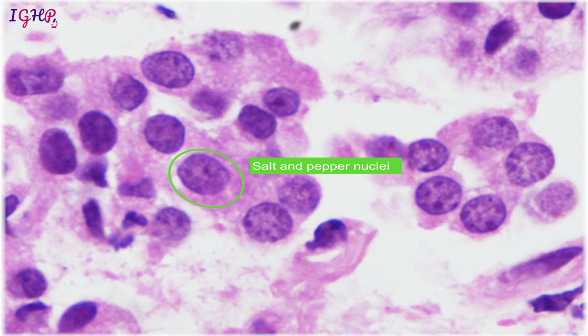The third type of nuclei that we see on histology is a salt and pepper type of chromatin, in which it is all finely granular. So instead of one prominent nucleoli, many times you will see one or two nucleoli like in this case, but generally in these salt and pepper type of chromatin, in most of the cases there won't be any nucleoli, and there will be some finely scattered light areas and dark areas. Now this is distinct from the plasma cell cartwheel appearance that we have seen, where you see in a spoke-like fashion the hyperchromatic areas, and this salt and pepper appearance will be like that. So you mix salt with black pepper, finely granular, so that granular appearance is going to be seen.